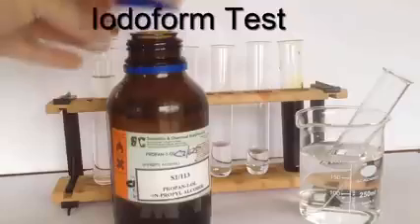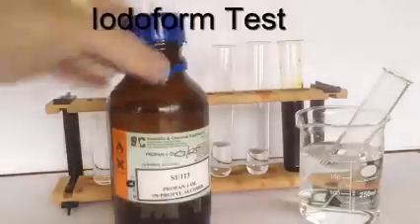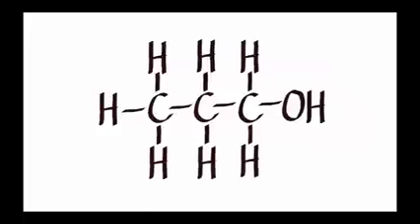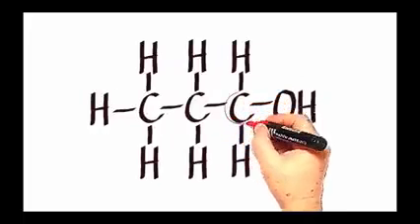So we need to take a look at the structure again of propan-1-ol to see why we have a negative result. It must be the case that the carbon holding the OH group is missing either the methyl group and/or the hydrogen atom attached to it. So here's propan-1-ol.